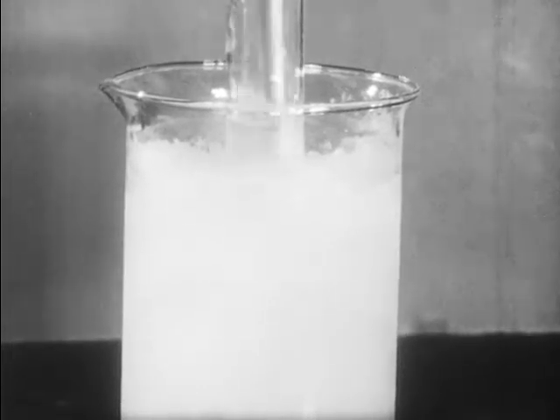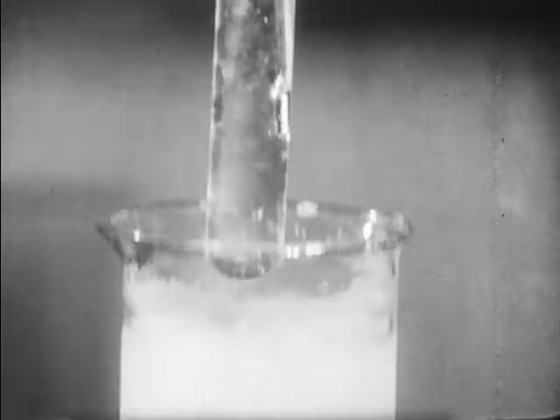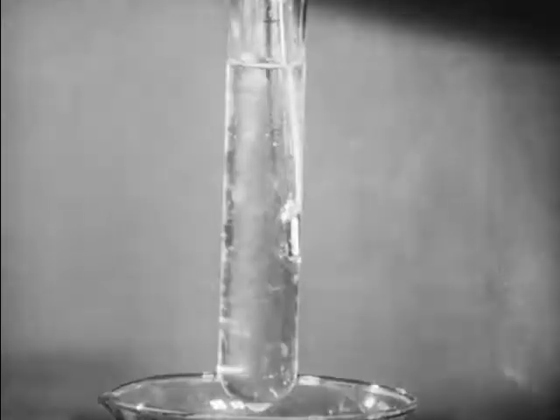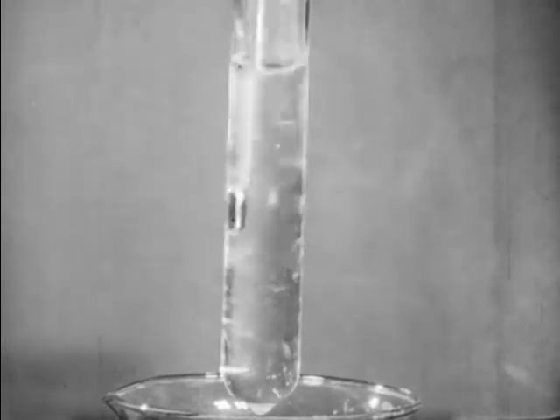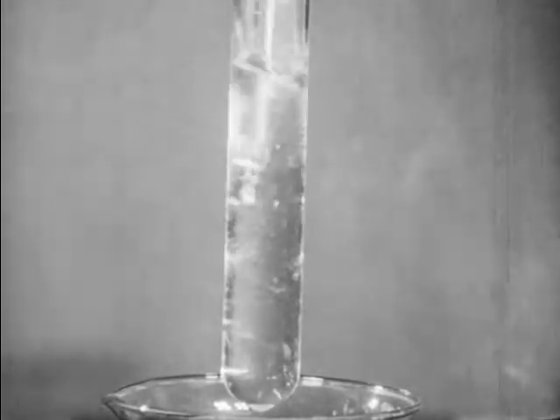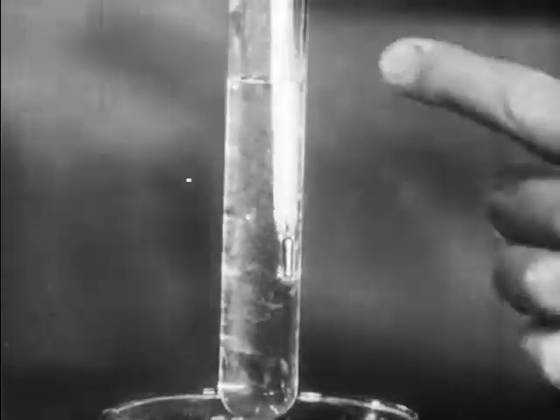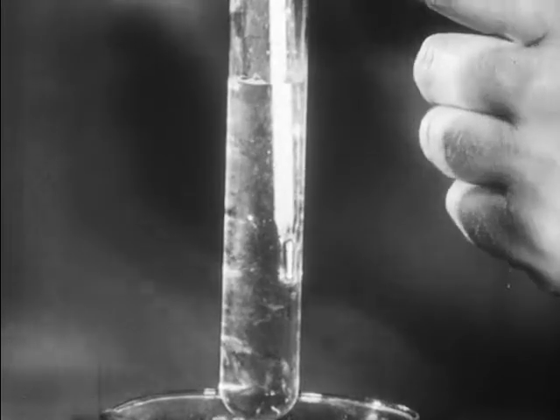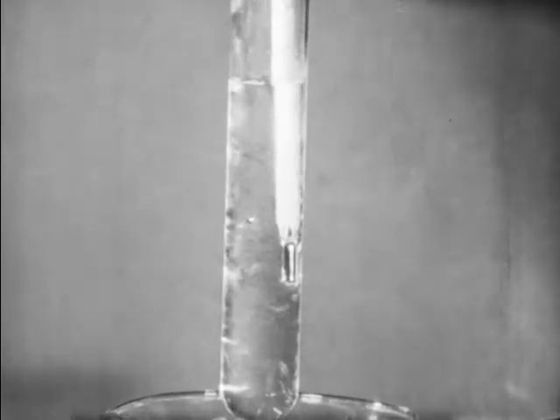We've now been stirring the tube and its contents for a few minutes. Considerable ice is formed in the tube. We'll raise the tube from the beaker. I think you can see the ice crystals inside the tube, but some water still remains. We'll read the freezing point of water as recorded by the thermometer. This turns out to be 1/10 of a degree centigrade.